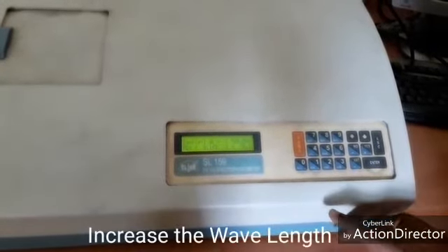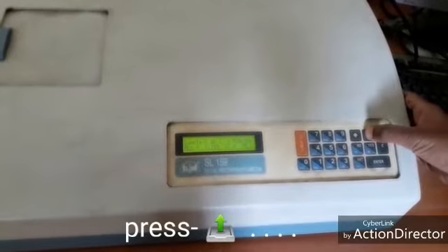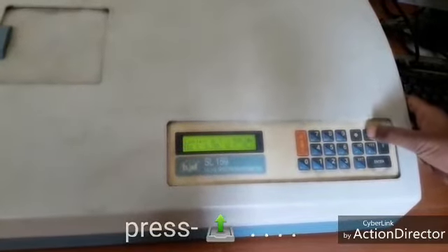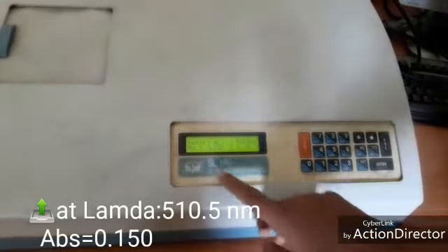Increase the wavelength by pressing this button. We are increasing the wavelength, lambda. Absorbance also increases. See here.